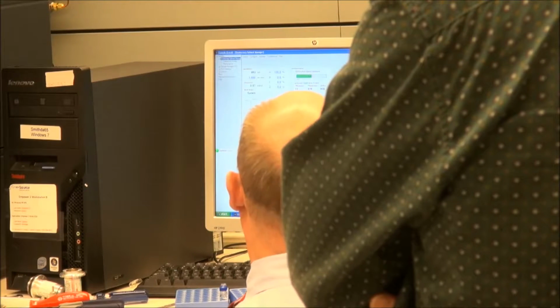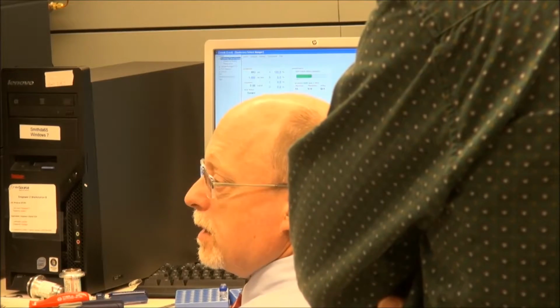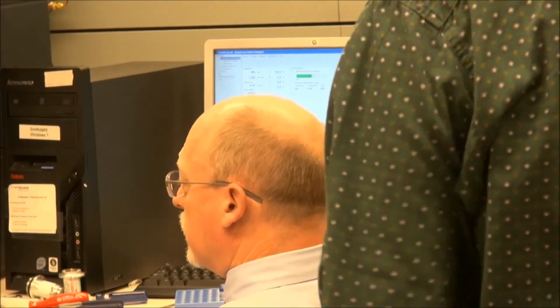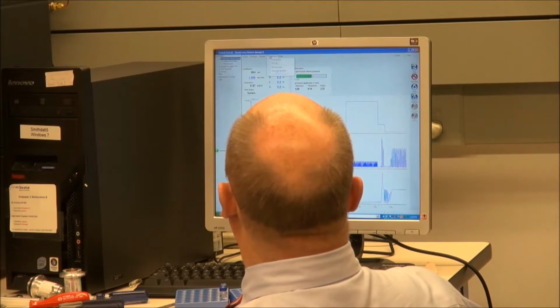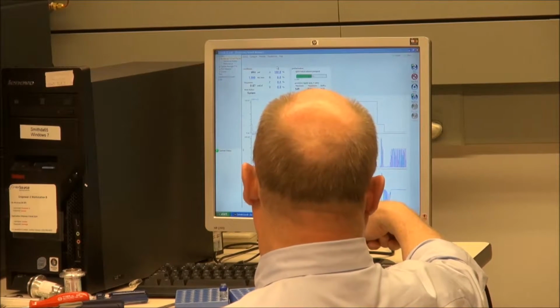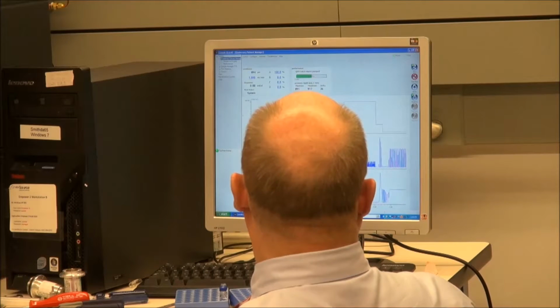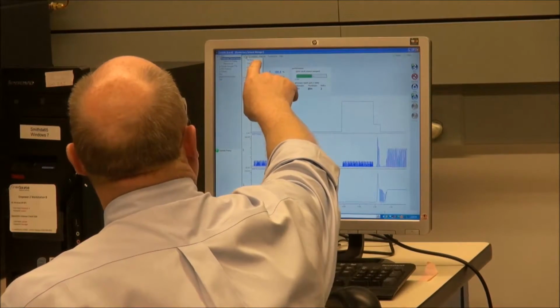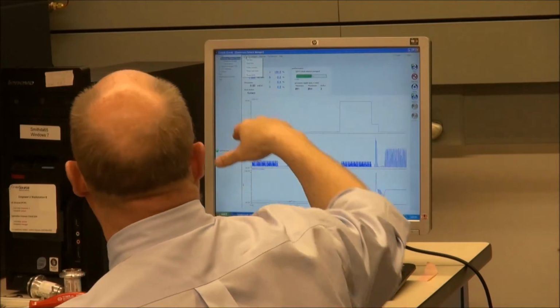So now that I'm running, I'm looking at my primary pump strokes and I'm looking at this nice flat line for my accumulator. That's what I want to see. Okay? Because I want to start doing my console test. My first console test on my pump, what I want to do is go into troubleshoot, go into service mode, and hit 1147. Okay. That's going to give me, on all Waters systems, more choices. So how do we get in the service mode? Go to troubleshoot, service mode, and it'll open the window 1147.